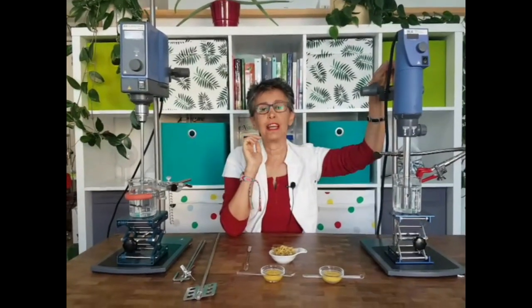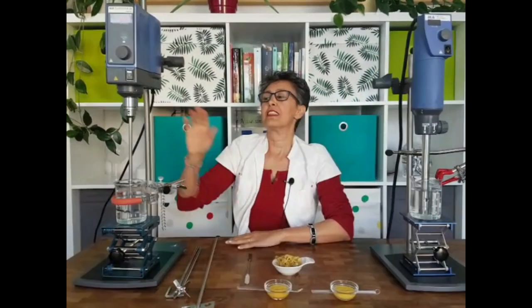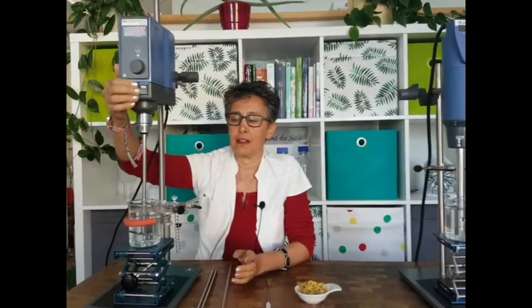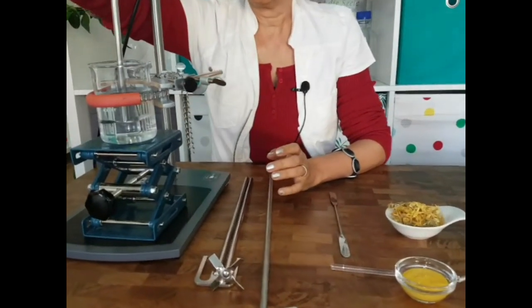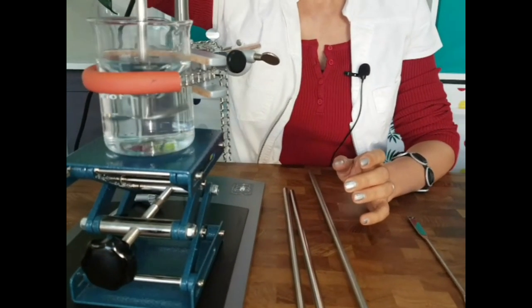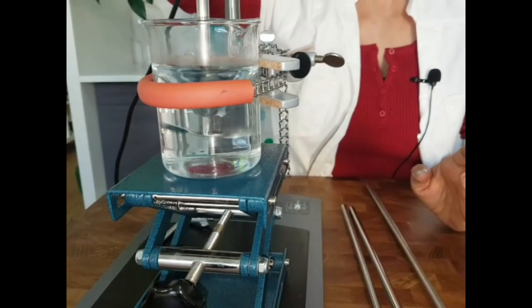This one is a homogenizer. Let me show you how they work. The overhead stirrer is comparable to your kitchen mixer, Vitamix, or the stick blender that you use. It has a radial motion — you can see that it's turning like this.